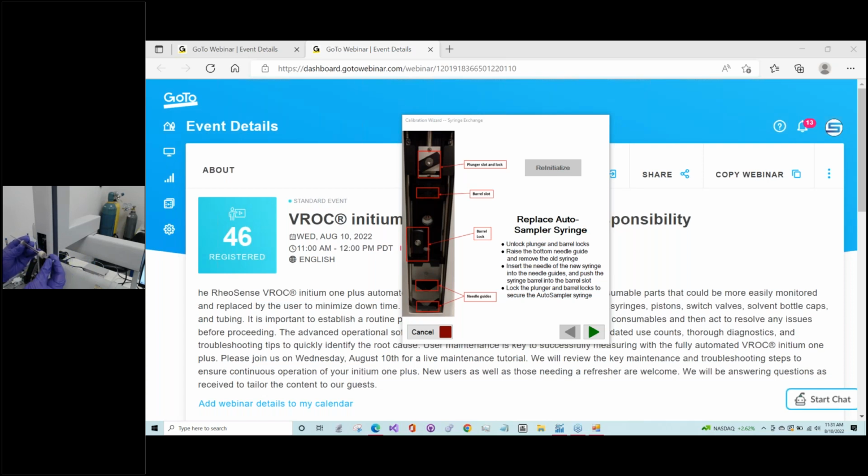Just a quick comment. They generally don't fail prematurely, but sometimes you do get a lemon, so to speak. So if you are having issues with a sudden drop in loaded volume, or perhaps unusual bubbles being loaded, that could be a sign that there's an issue with either the piston failing or aging, or perhaps, just like other parts of the system, if you're dealing with a lot of difficult proteins or antibodies, sometimes you could get build up there as well. So this is a common place to look if you are seeing some issues with loading, particularly low volume or bubbles introduced into the test syringe.